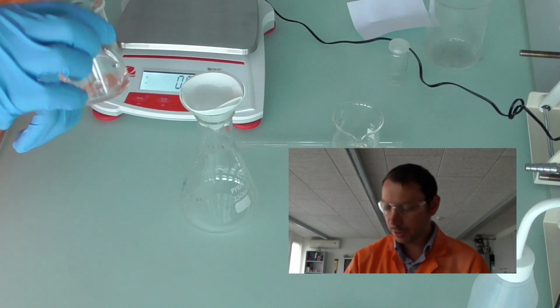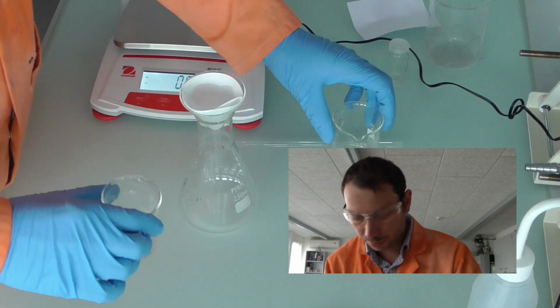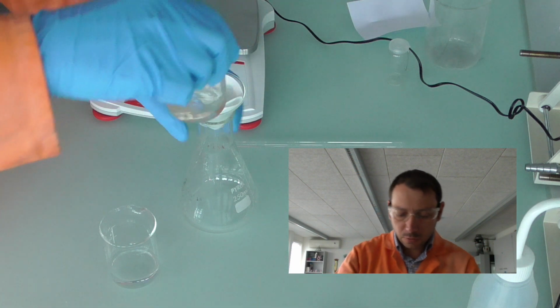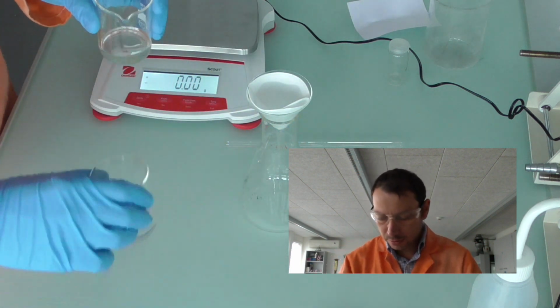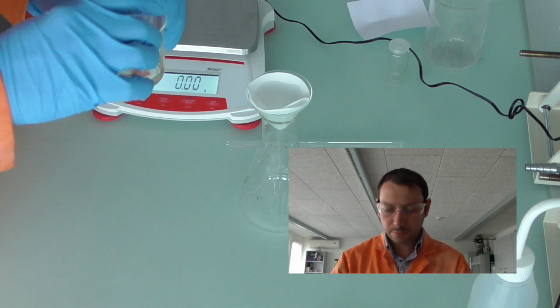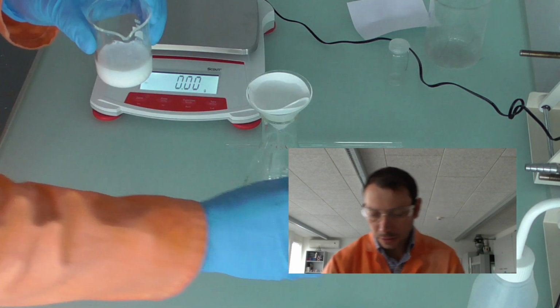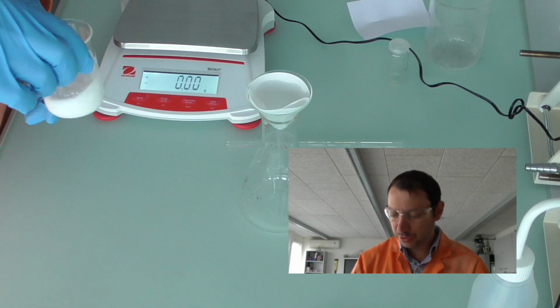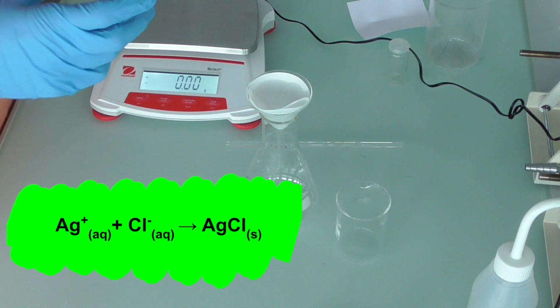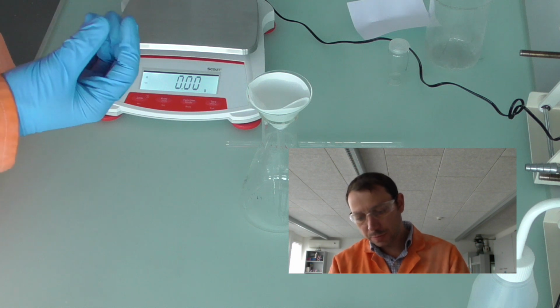Whilst that has happened, most, if not all, of my sodium chloride and my silver nitrate has dissolved. If I'm unsure, I can use a glass rod. I'm now going to add the two together. And we can see, hopefully, a reaction has taken place, and that reaction has made it go cloudy. Our next step is to try and collect all of that solid which has made it go cloudy.